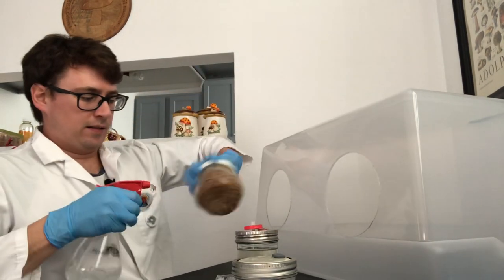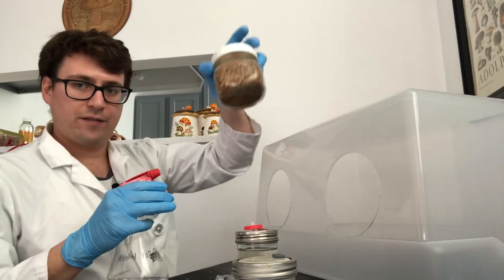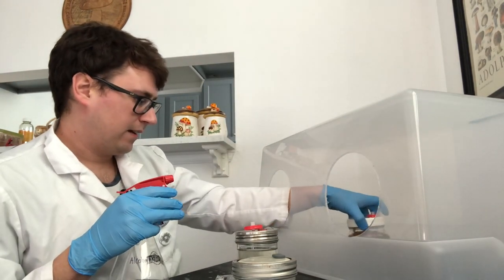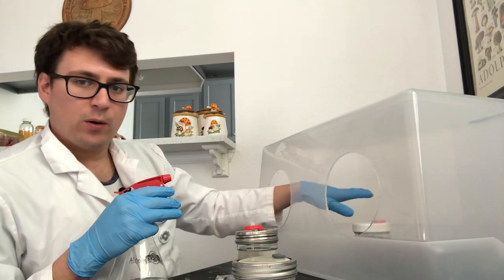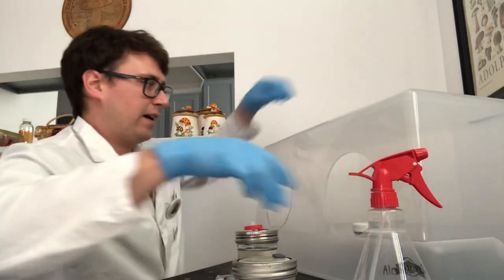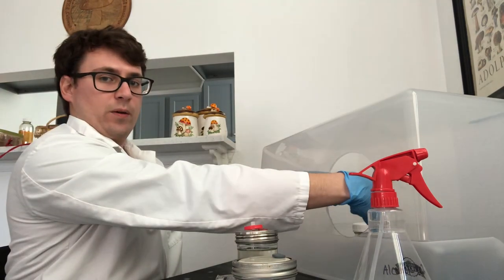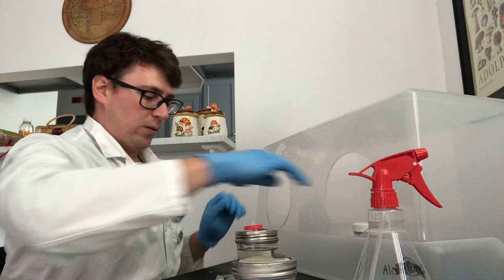First you're just going to disinfect the outside of the jar. I believe that the most clean area is directly in the center and it's the easiest to work with while you're working through these holes.